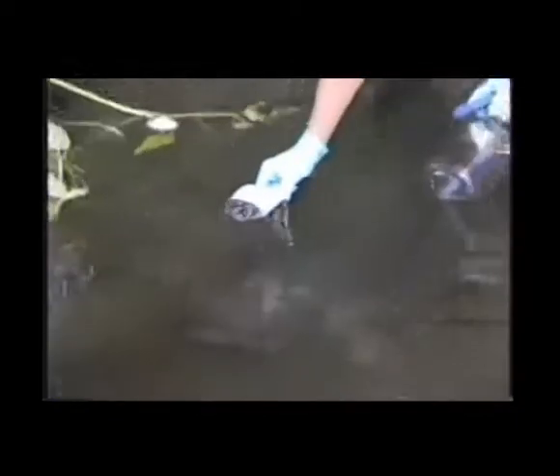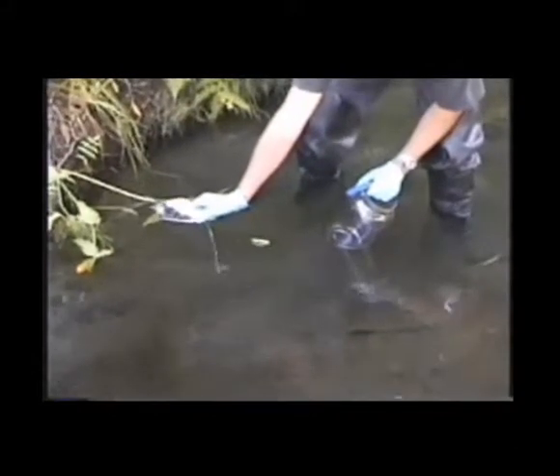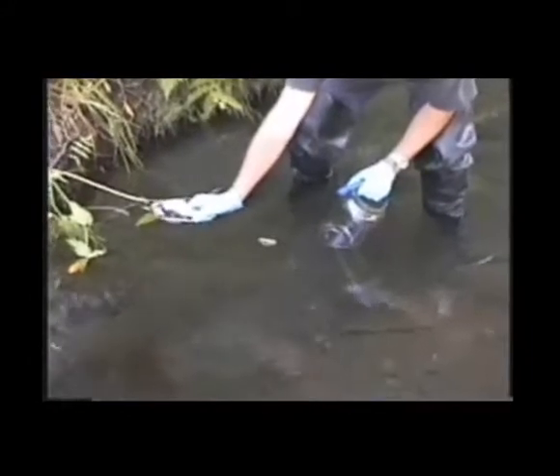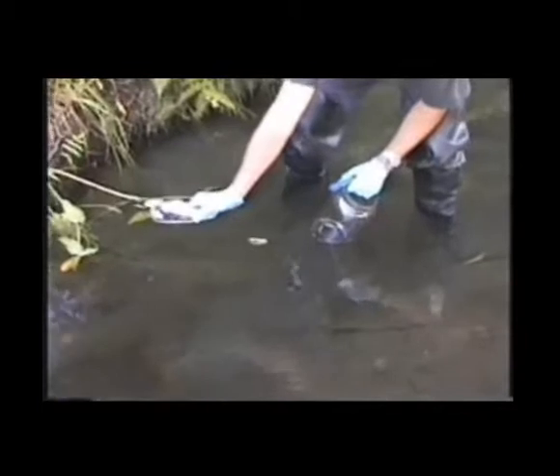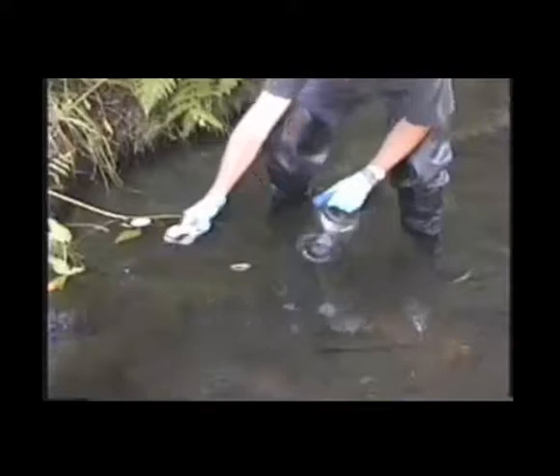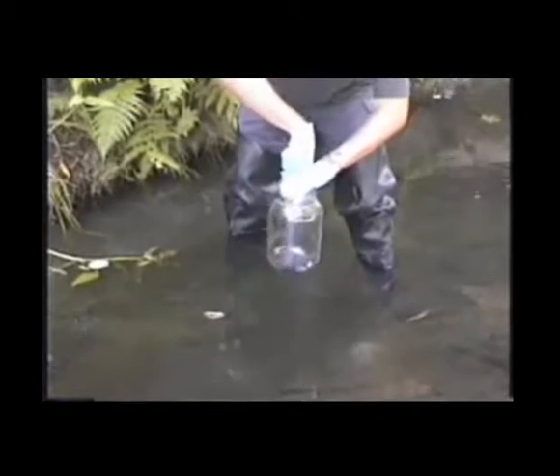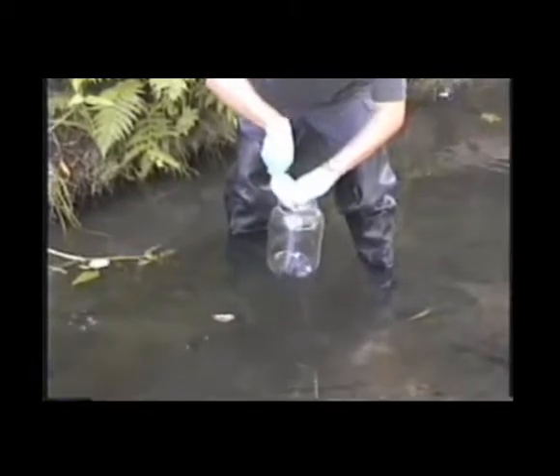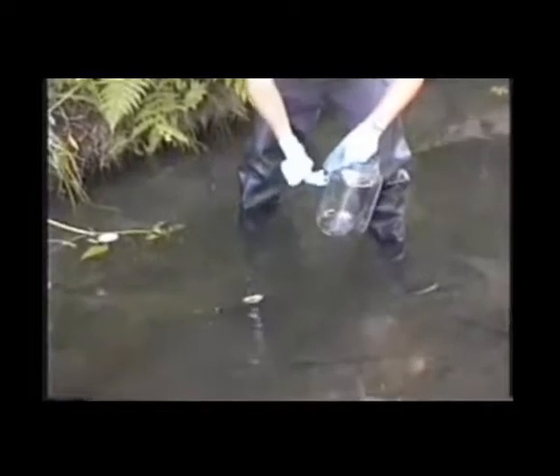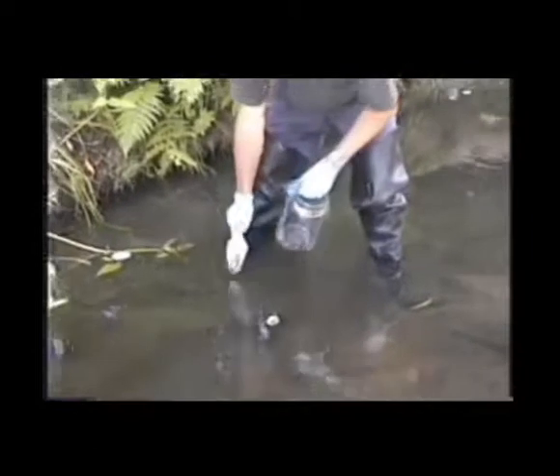Slowly pull it back up out of the water. I will let all of the surface water, or overlying water, that was on top of the sediment drain off, and I will want to keep all the pore water that was in the sediment in the scoop, and then I will dump that into the homogenizing jug and repeat this process until I have filled up the desired amount of sediment that I want for all of the smaller jars that I want to aliquot into.